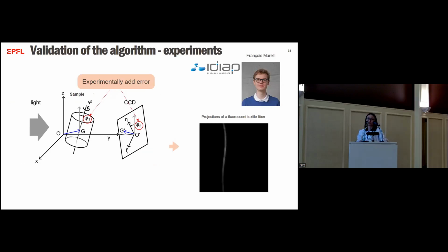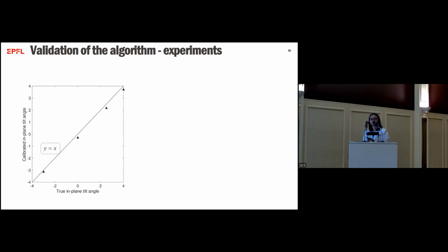We also validated our algorithm on experimental data sets of fluorescent fibers. So what we did is we want to calibrate the 3D tilt. So we experimentally added error by tilting the rotation stage to different directions, psi 1 and psi 2. Then we acquire these projections. We tried our calibration on 4 different cases of in-plane tilt angles. And in all the cases, we start from a zero guess, so we don't have any information about the tilt angle. And then it turns out calibration managed to find a value that is very close to the true angles.